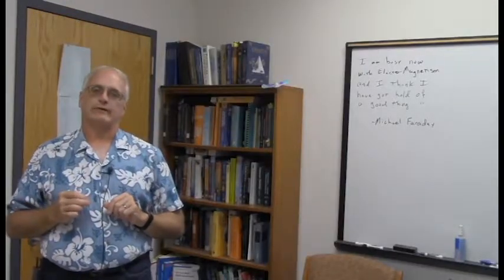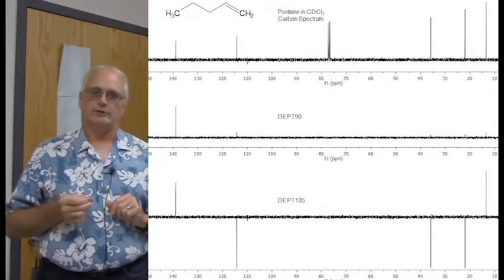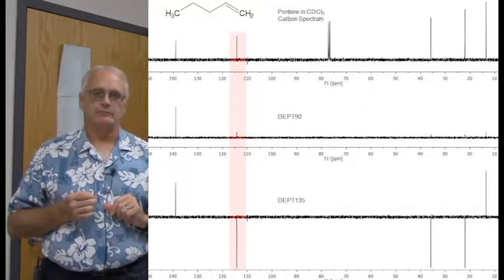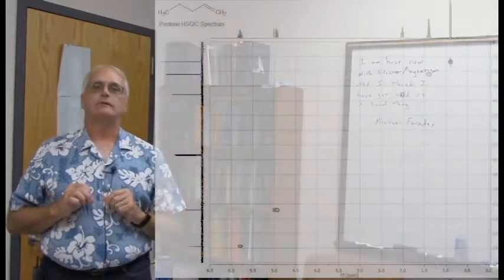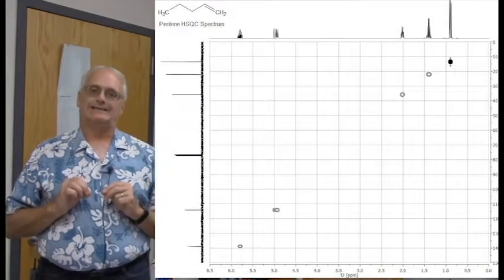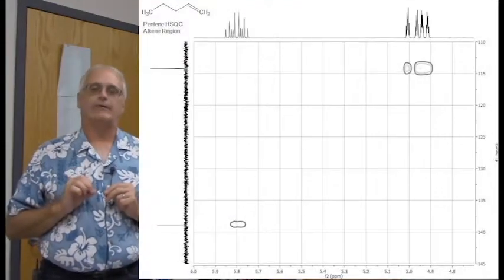Once again, our dear friends, the DEPT spectra, will help us identify the terminal methylene group. It's at 115 ppm, just like it was before. And then, of course, the HSQC spectrum. Now, here's the full HSQC, but our focus is most importantly on the alkene region. And so here is an expansion of just that area of the spectrum.